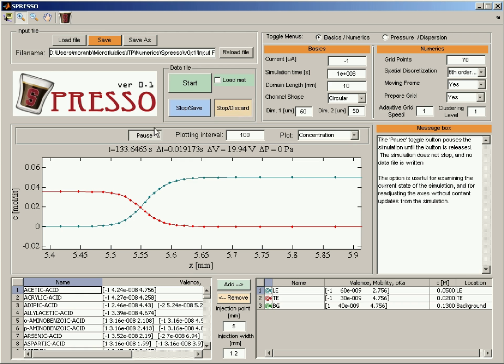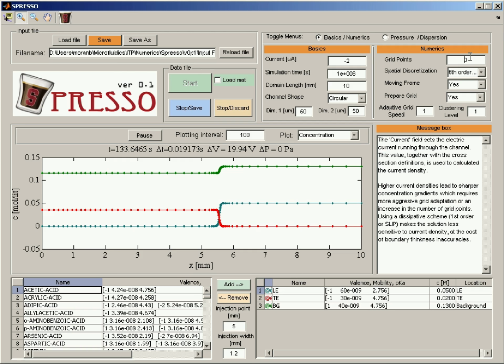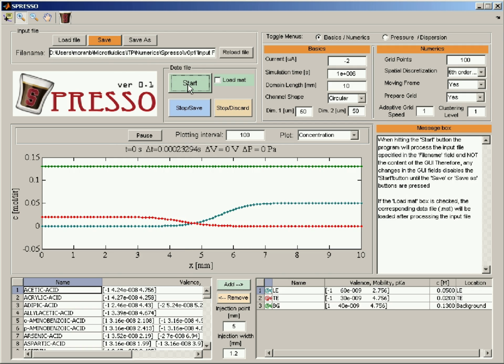Let's stop this simulation. And let's see what happens when we go to higher current densities. So the interface should be sharper. So let's go to 2 microamps. Perhaps let's increase the number of grid points to 100 because we will need it. And save. Let's run this now. And let's see if we have enough grid points to resolve it. So we're on the edge, but yeah, we were able to resolve this one.